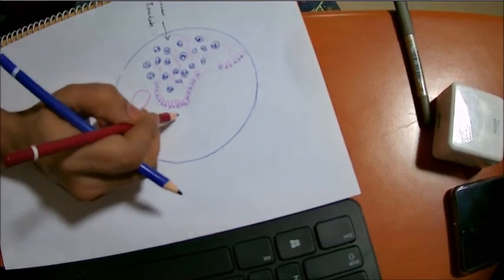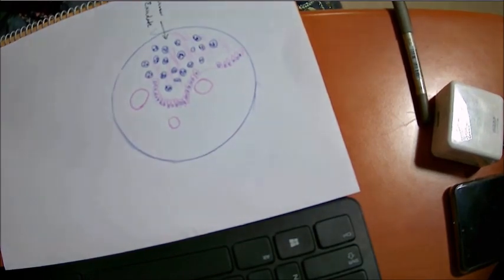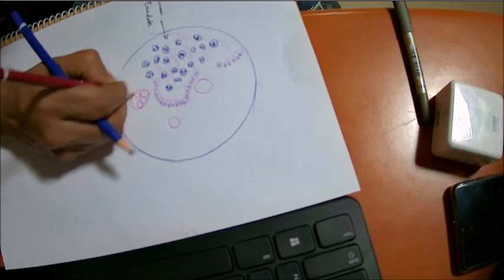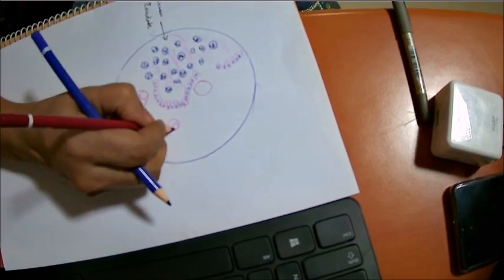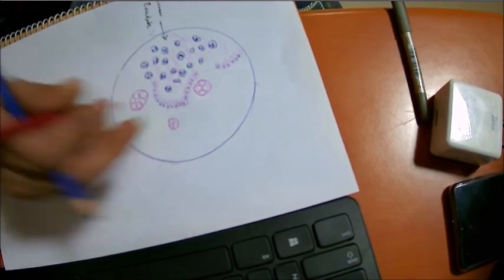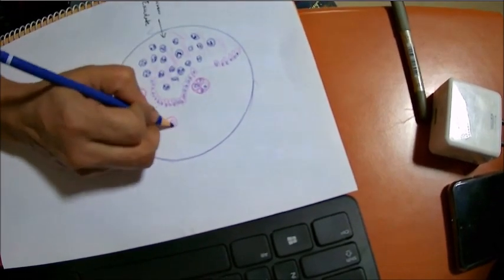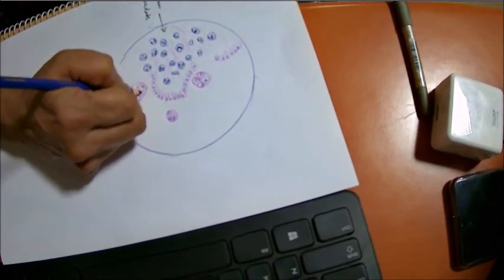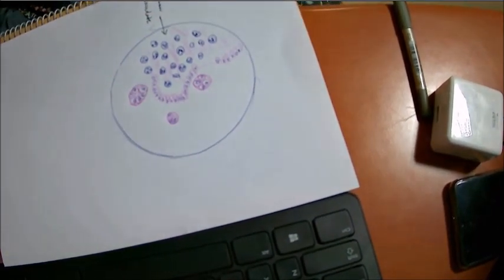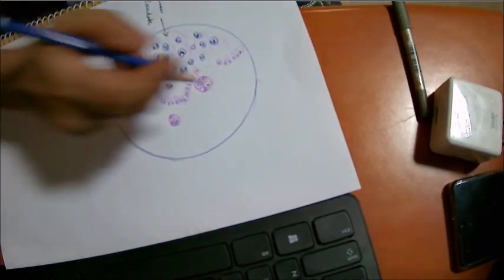Now next is the glands. We said they all look like intestinal glands, but a lot of goblet cells would be there. So a few glands you can draw. To show goblet cells, make them plump, having mucin. So the nuclei for these glands. Yes. The mucosa actually has plenty of lymphocytes.